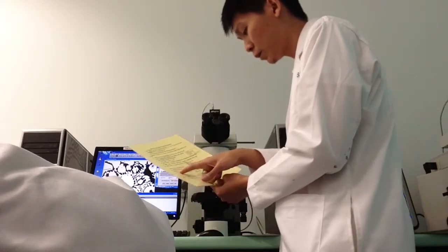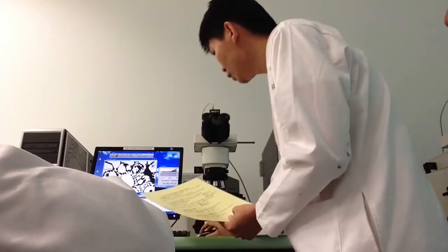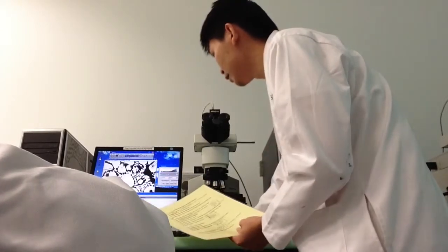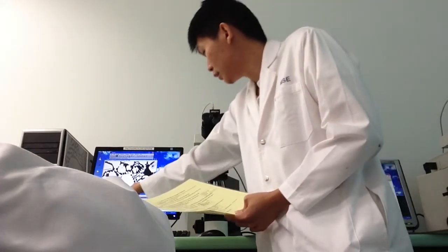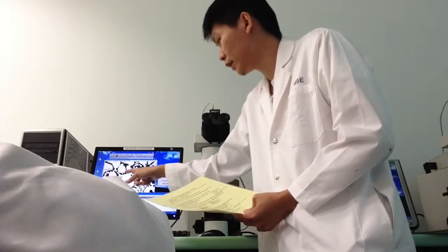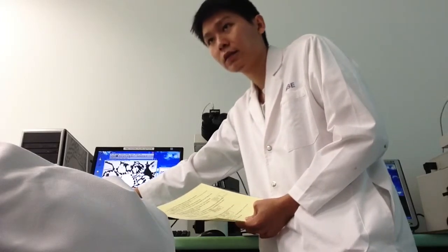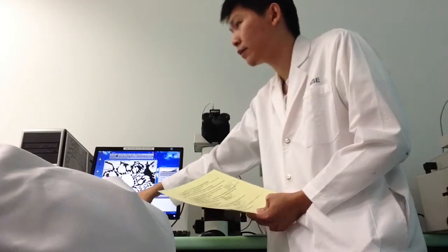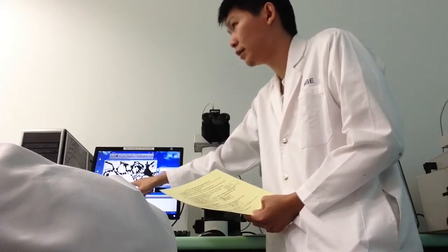You do step number 14, which is to click analyze and measure. This will give you a second set of data. This second set of data is only your freehand area. So the area is 2266, and the percentage area is 4.895, which is the black region percentage inside this yellow freehand.